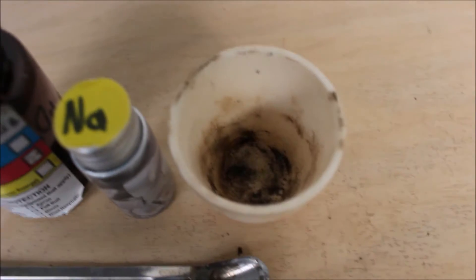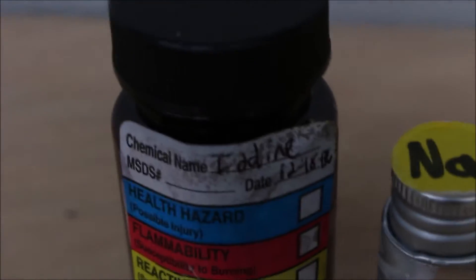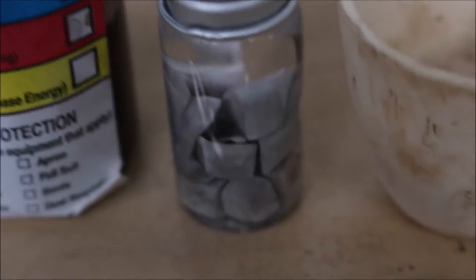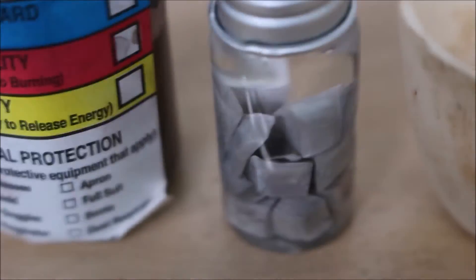How we're going to carry this out is we're going to place the iodine in this crucible right here. Here we are. And in this bottle, I made the iodine in the last video if you remember, and this sodium is just a bottle of sodium that I got as a sample.